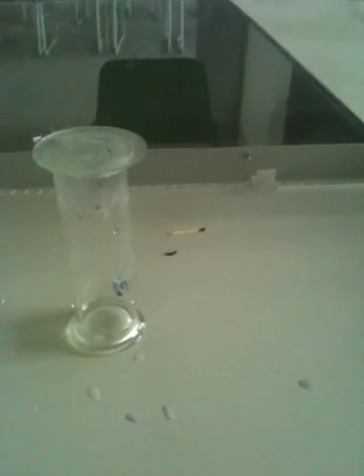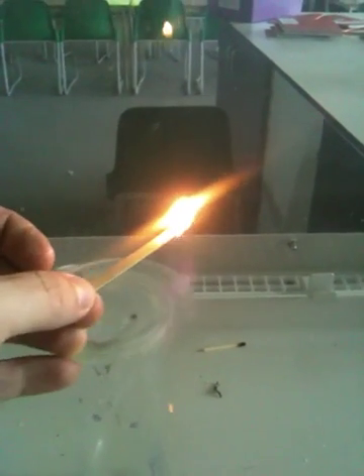If I take this out — oh, that didn't work. Let's try again; might have lost all the hydrogen. It might jump a bit as well. Fantastic — so hydrogen with the splint gets the pop. None of the others really reacted, apart from oxygen, which relit the splint when we blew it out.